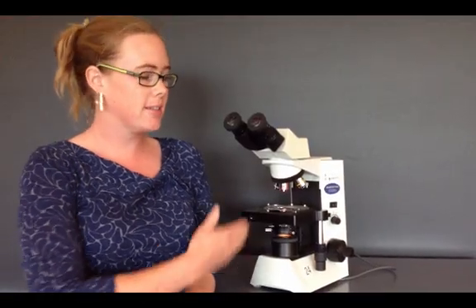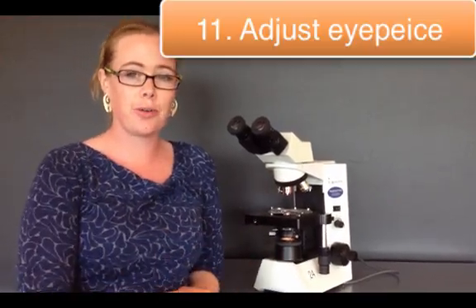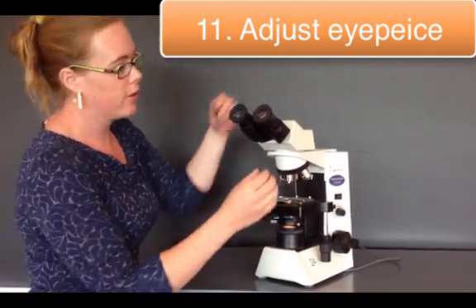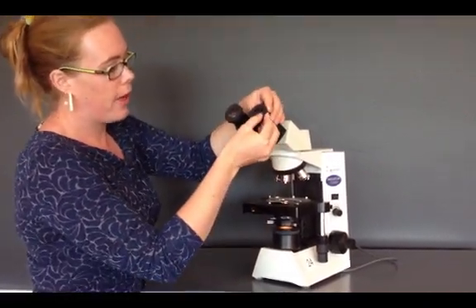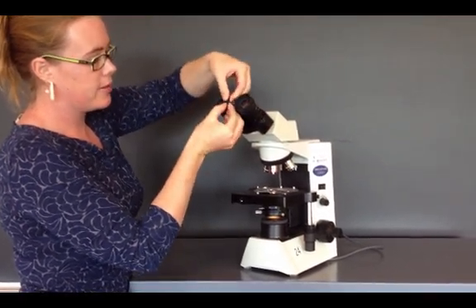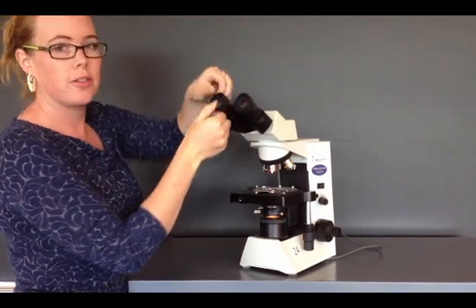Now you need to set your eyepieces to your facial dimensions. The first thing you can do is flip up the outside ring on the eyepiece. This provides like a little buffer zone between, say, your glasses and the microscope.